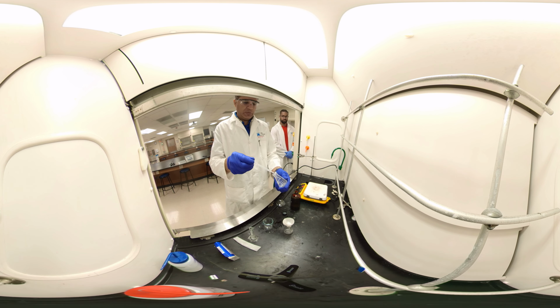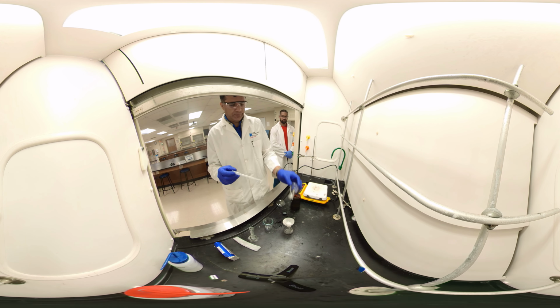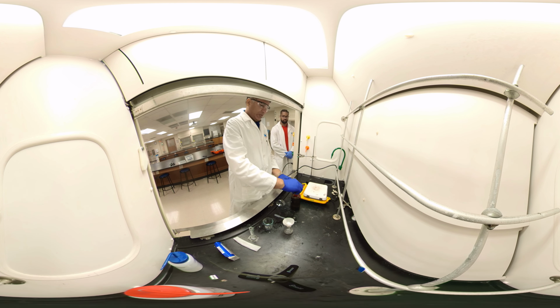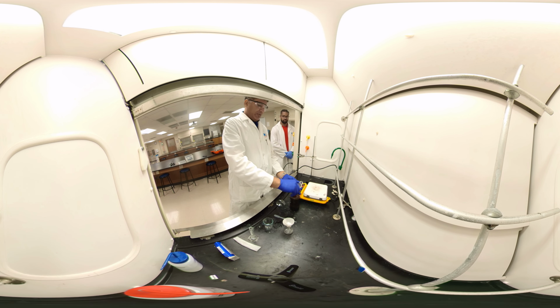And whatever dissolved is transferred. So whatever the solid is, it should be the binder or acetaminophen.